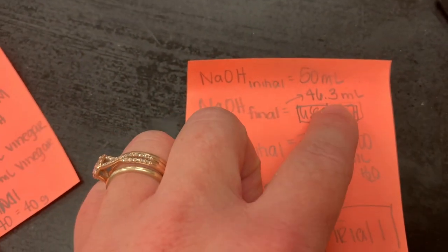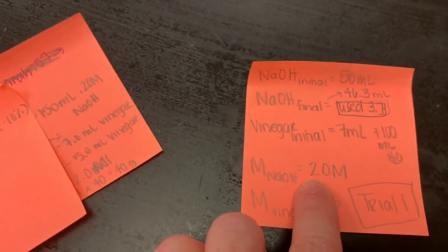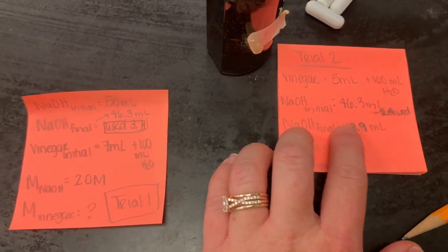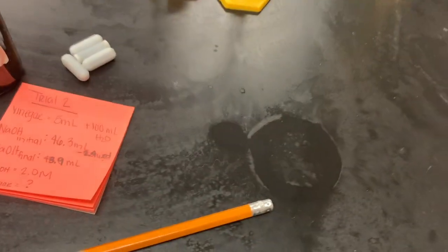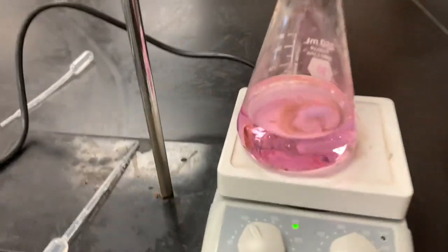So here's our data. For trial one, we initially started with 50 mL and finished at 46.3 mL, which means we used 3.7 mL of NaOH. I've got our original vinegar volume and molarity here — you're going to solve for the molarity of the vinegar. For trial two, we went from 46.3 — I didn't even refill the burette, I just used it from where we left off — and got down to 43.9 mL, which means we used 2.4 mL. Same concentration, so we'll go from there.